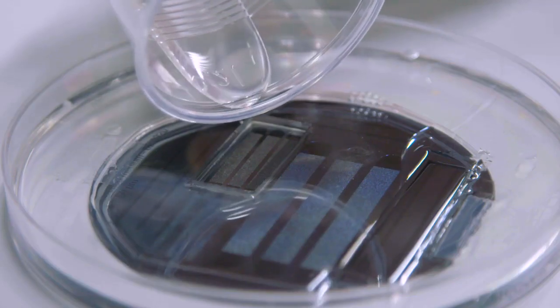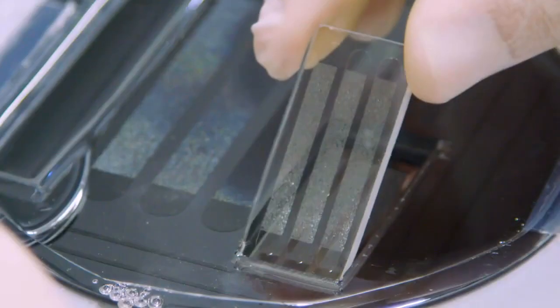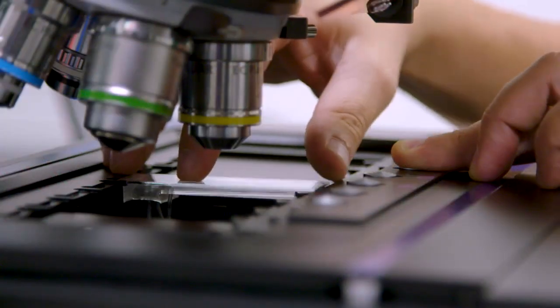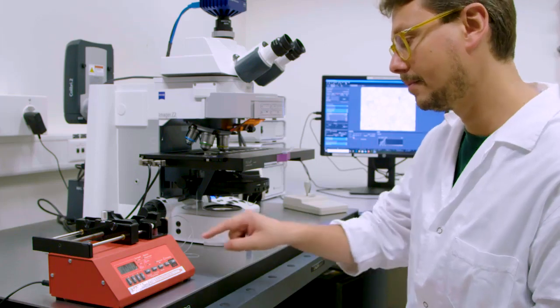Here we present tools to study bacterial transport using microfluidic devices and microscopy, as well as larger devices in combination with flow cytometry. The combination of microfluidic devices with microscopy and flow cytometry offers a range of possibilities to study bacterial transport phenomena at different spatial scales.